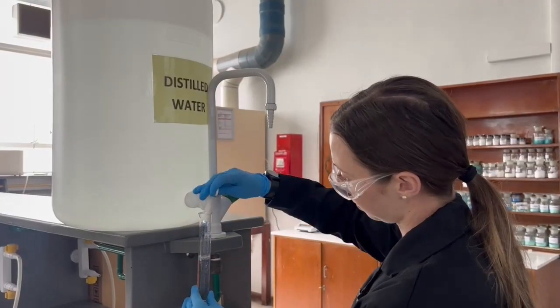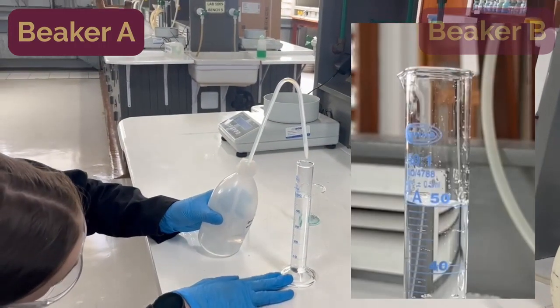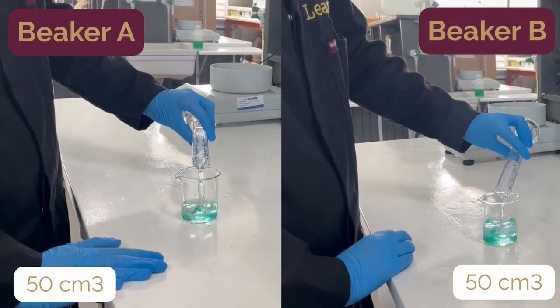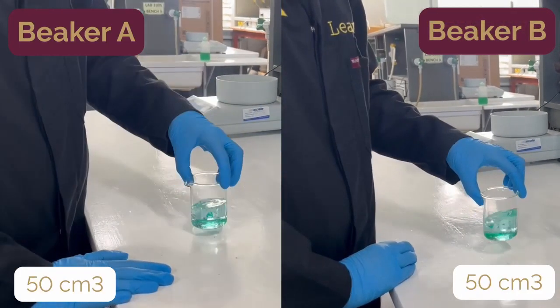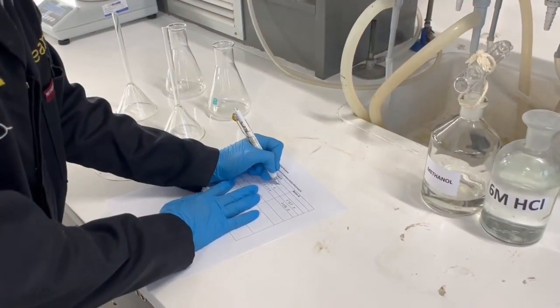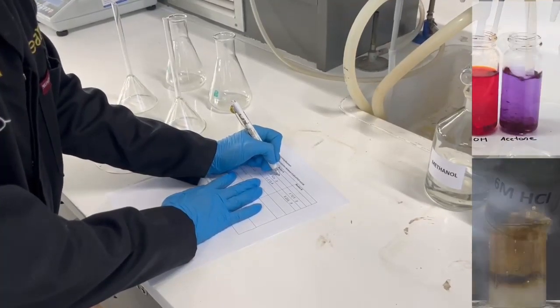Now use the graduated measuring cylinder to measure approximately 50 cubic centimeters of distilled water and add this to each of beakers A and B. Swirl or stir the beakers alternating with a glass stirring rod. The reaction should take about 15 to 20 minutes to complete. As the reactions proceed, record any observations in the data report table. This includes color changes, bubbling, etc.